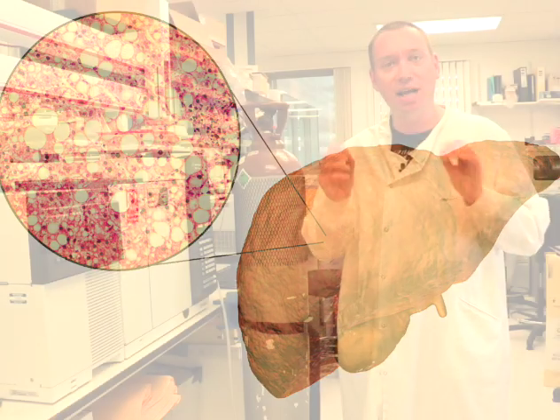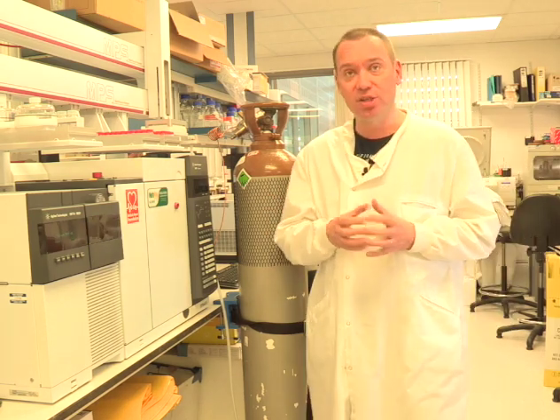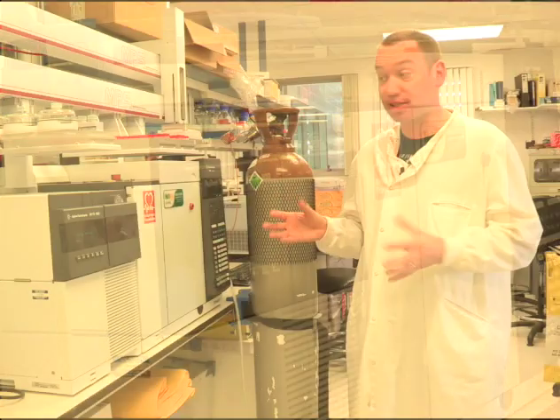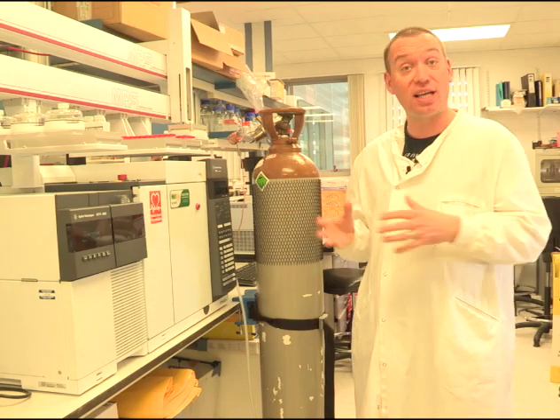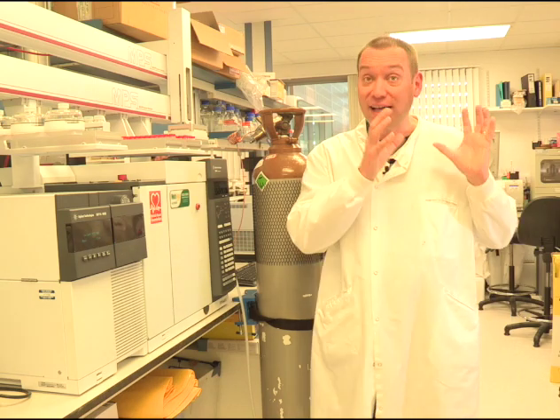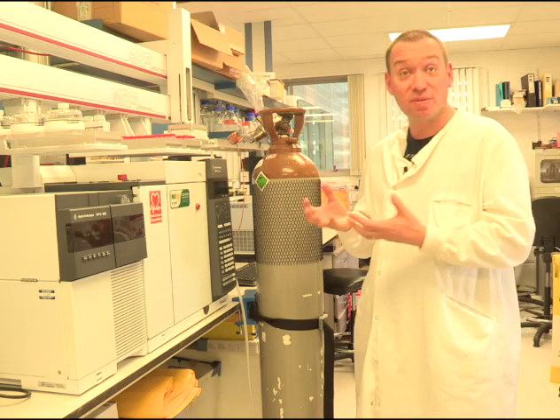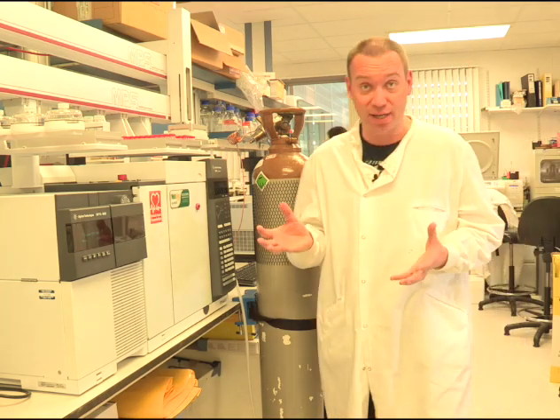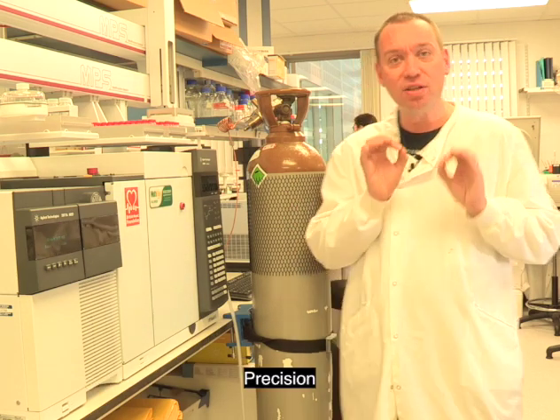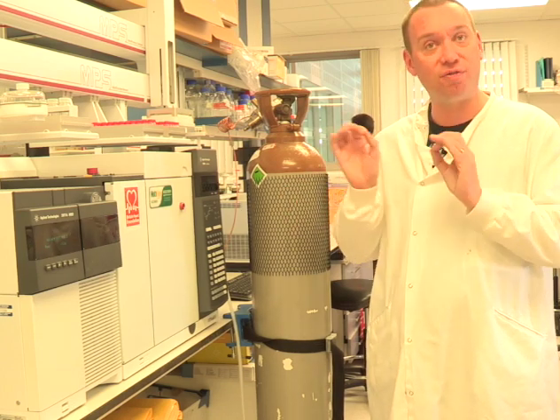How do we actually measure how much of the different kinds of fats we have in our bodies? One of the ways we can do this is using this machine here. You may be familiar with weighing scales at home — maybe they weigh to the nearest gram or a tenth of a gram. We have very fancy weighing scales in the lab which can weigh to a thousandth of a gram. A mass spectrometer can weigh a billionth of a billionth of a billionth of a gram, and this kind of precision enables us to tell exactly what different kinds of fat we have.